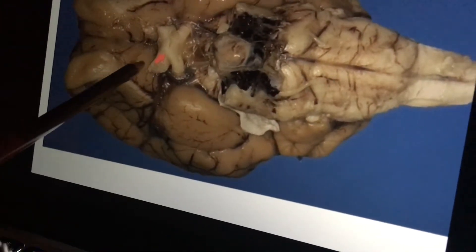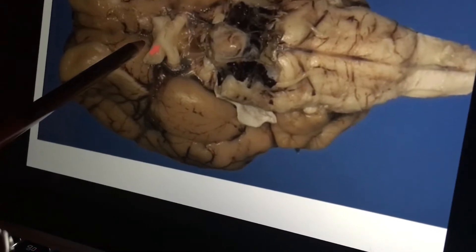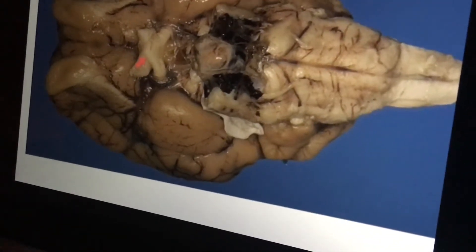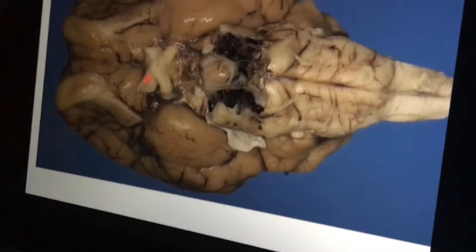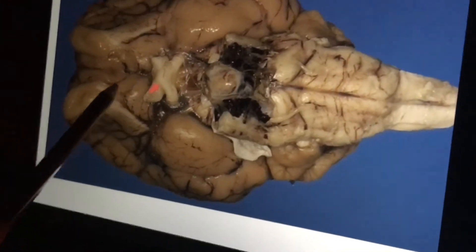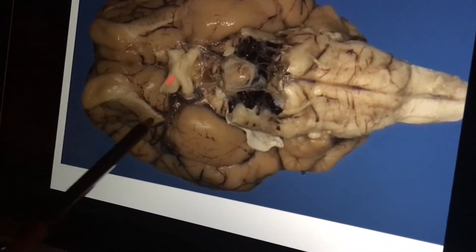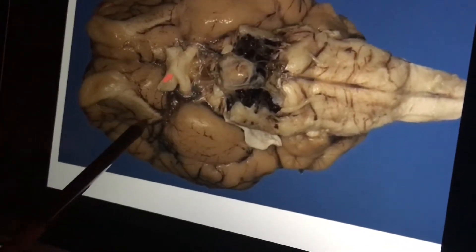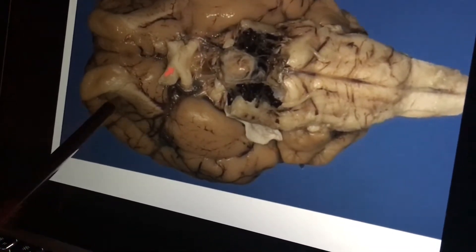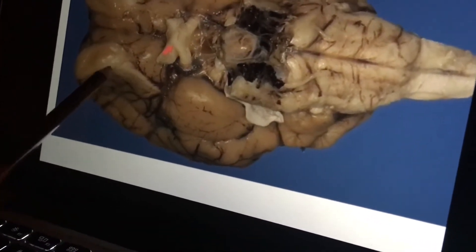Here is the infundibulum. This is the trigeminal nerve and the abducens.